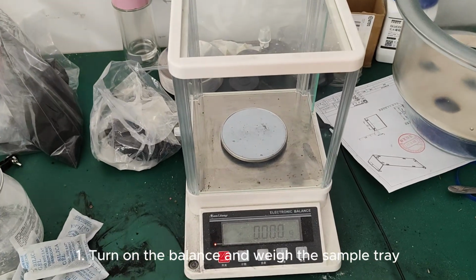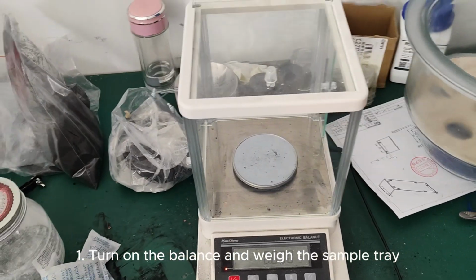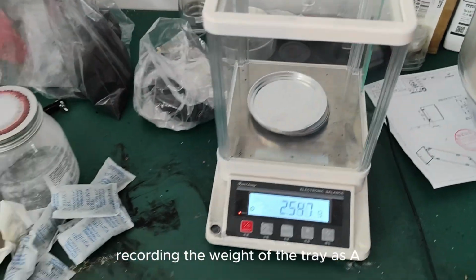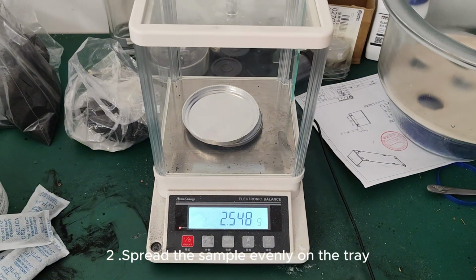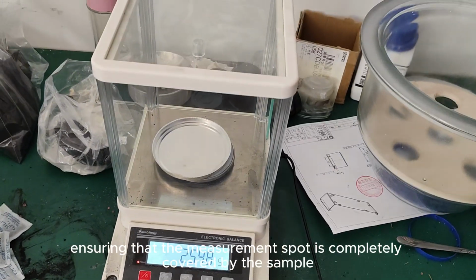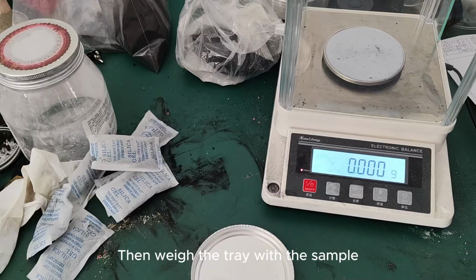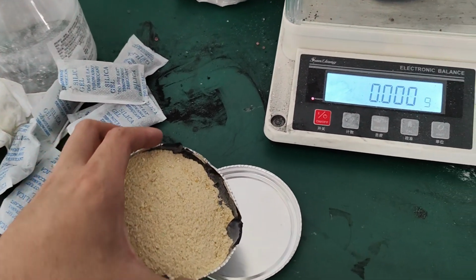Standard sample preparation. 1. Turn on the balance and weigh the sample tray, recording the weight of the tray as A. 2. Spread the sample evenly on the tray, ensuring that the measurement spot is completely covered by the sample. Then weigh the tray with the sample, recording the weight as B1.